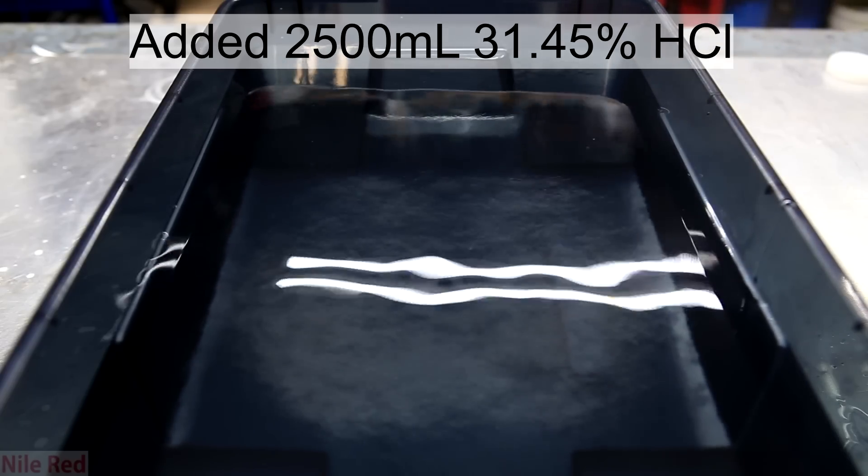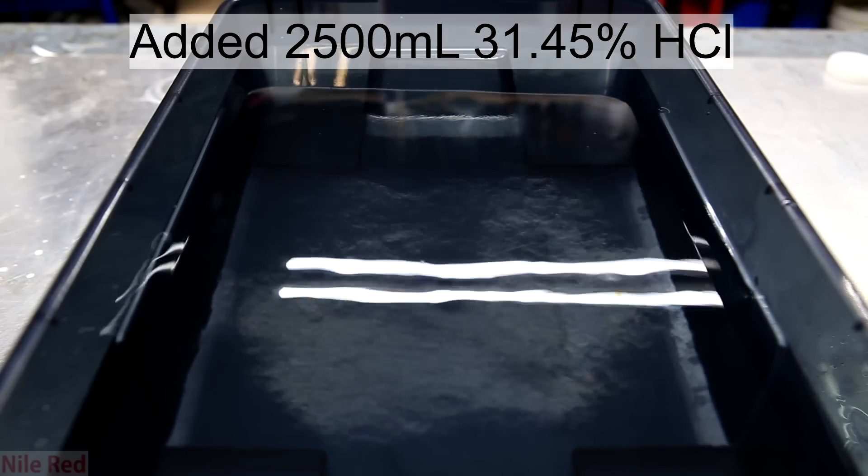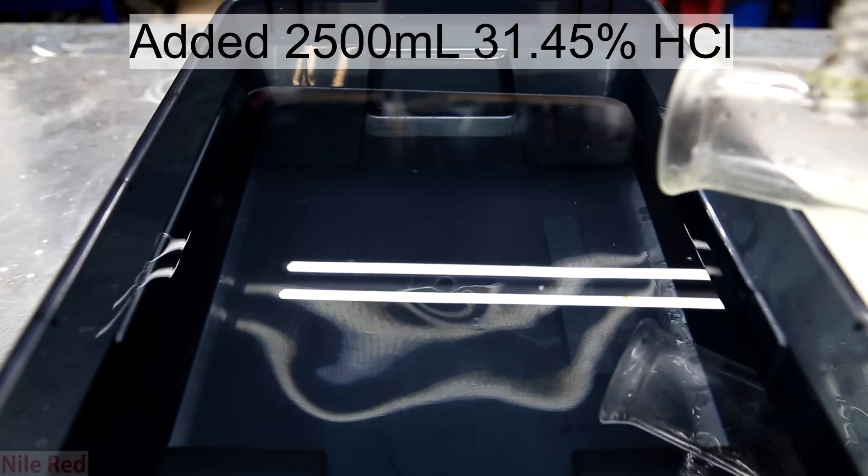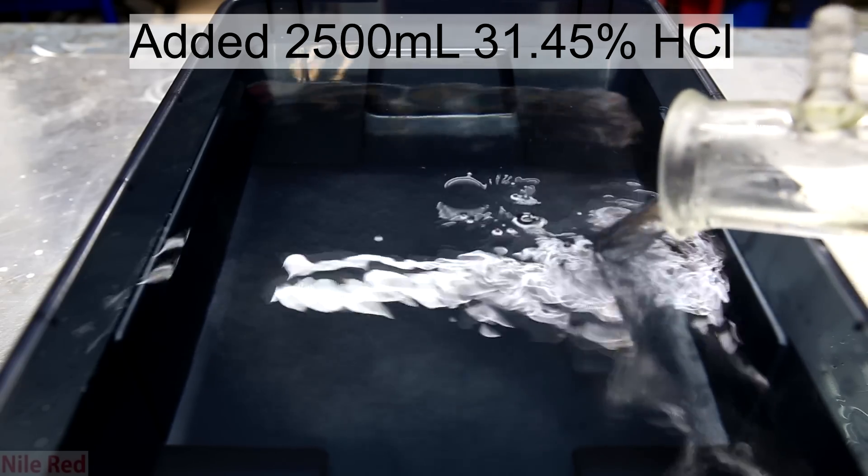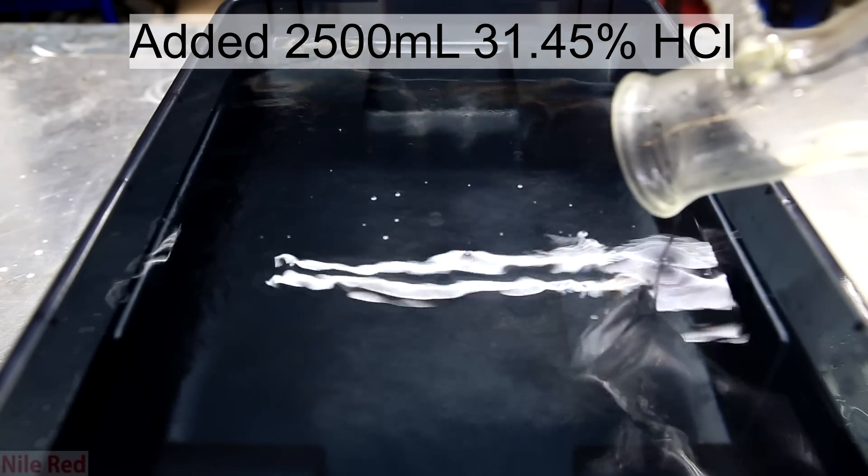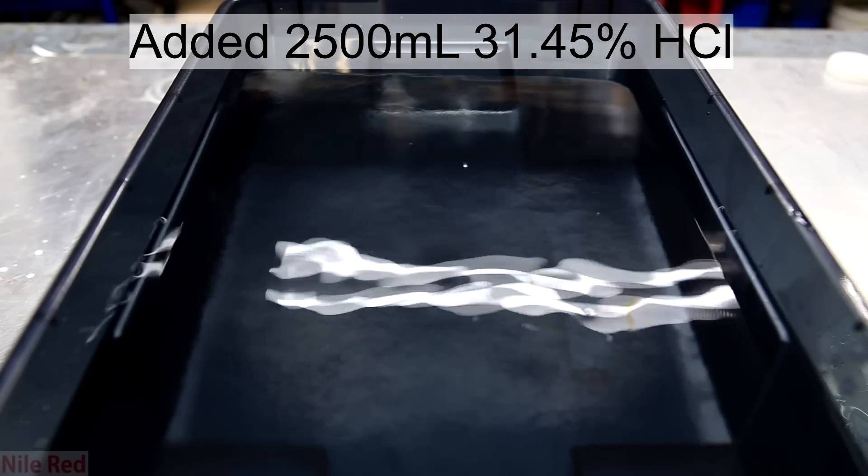Making the acid bath is pretty simple in general because once the acid is added it's actually done. And to even add to the easiness, I didn't even mix the acid in and I simply just let diffusion do its job.